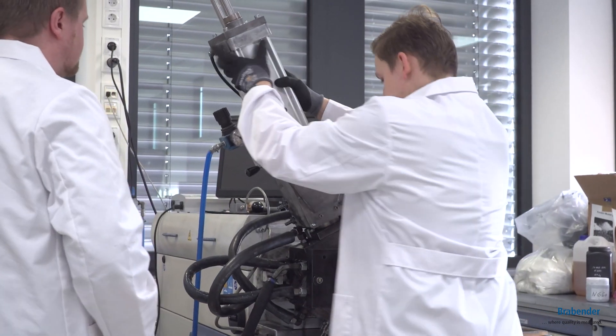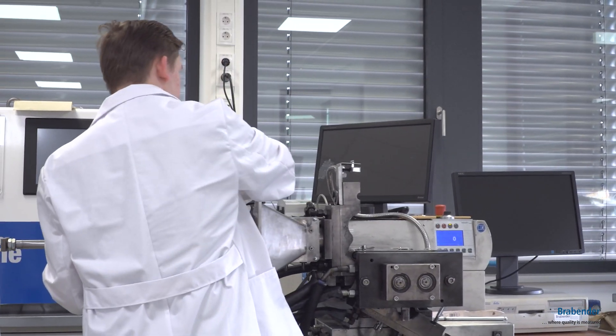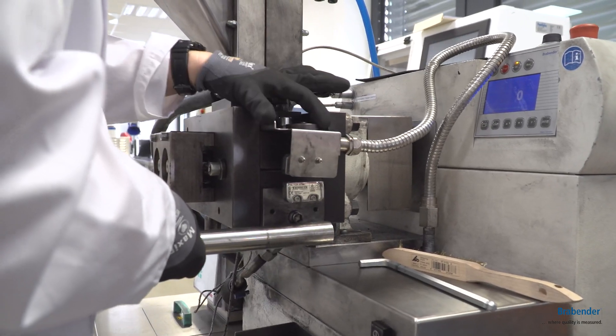Then we have our 350S mixer, where we can measure the properties of rubber and we can also produce rubber for testing after the preparation.